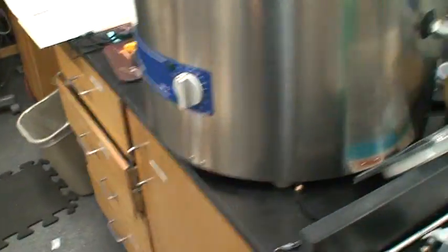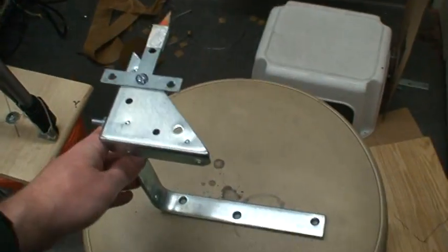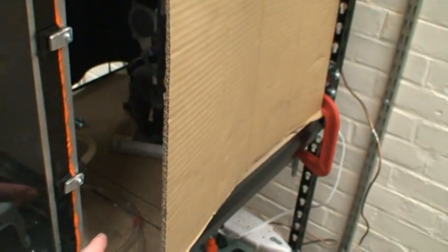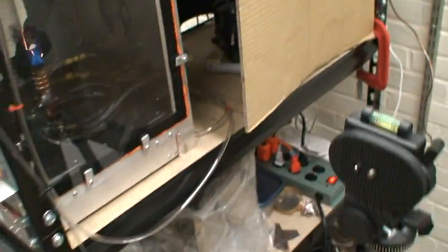It looks like it's fairly easy to do. One thing for ease of use later, I've done a couple of things. I built this, which is basically a mount for where to put the point source. So if you move the point source, you will line up the bottom of this with these lines and the edge of the apparatus here, and that'll tell you where to put the point source back to have it in the right place to get the Shadowgraph to work.